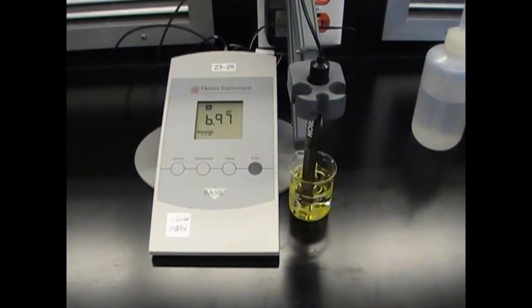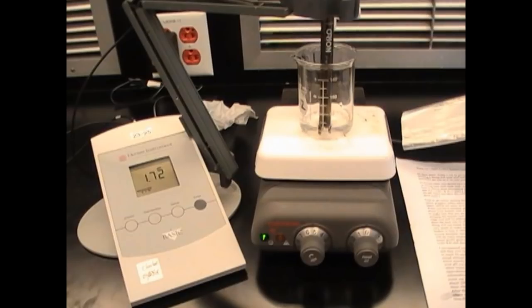Insert the pH meter probe gently into the beaker and be extra careful not to break the probe. Replacing it costs 40 dollars.